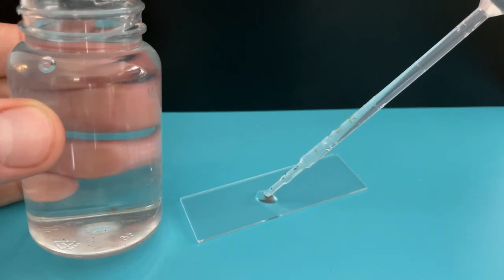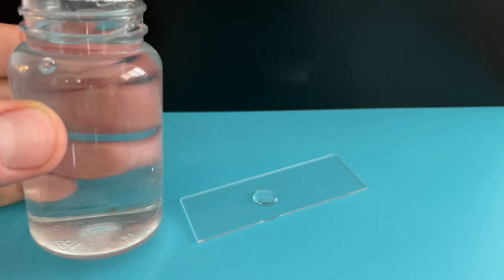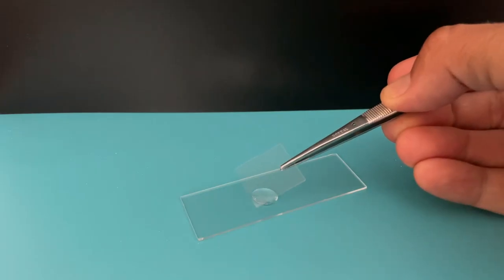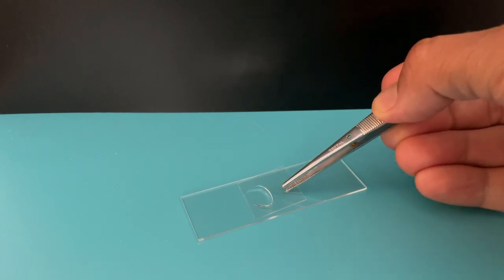Let's see what creatures we see in this little drop of ocean water.